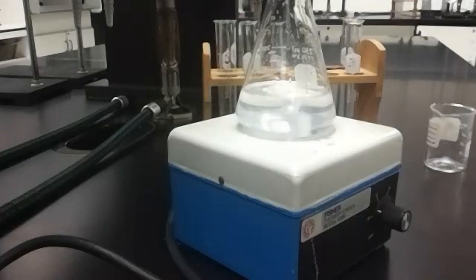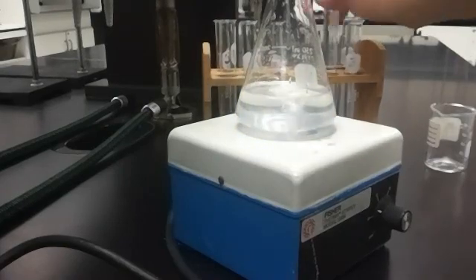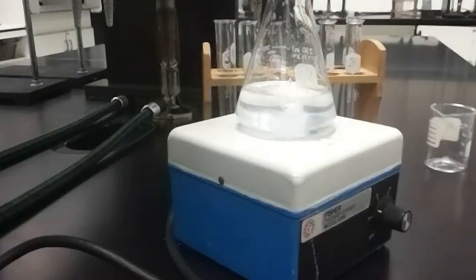I'm just waiting for the color change. We'll show it to you one more time. There's the color change. Okay, so it turned colors. I would pour in this and start the timer again. So we measure the time between the color changes. Now I'm going to pause the video and switch over to Excel and show you how to analyze the data.